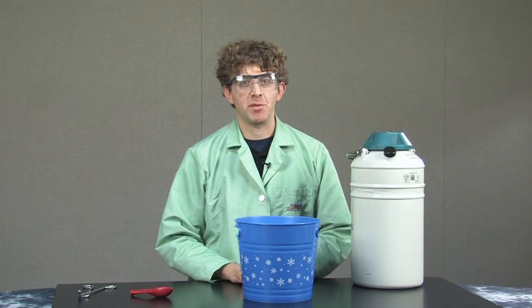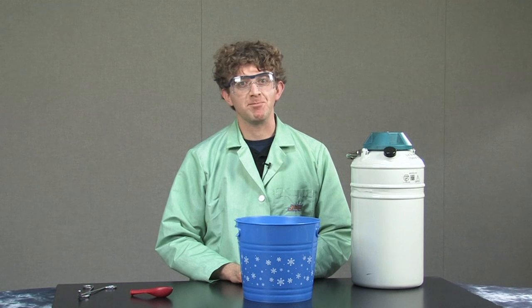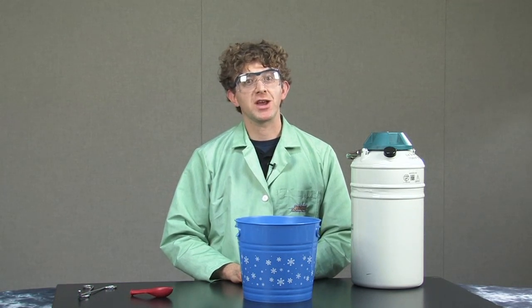Hi, my name is Kevin Caron and I'm a professor in the chemistry and biochemistry department at James Madison University. And I'm going to show you a demonstration today called Shrink a Balloon.